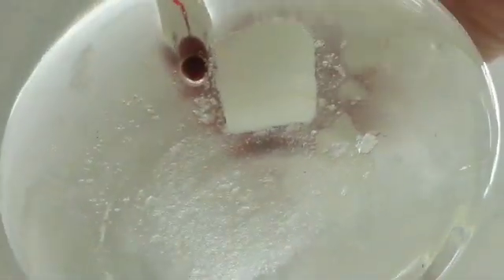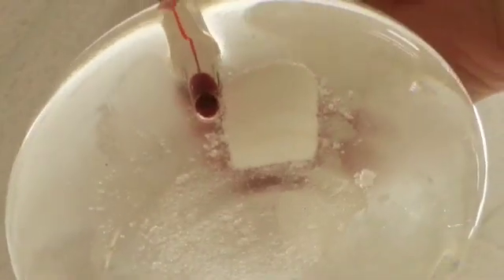So another thing to consider too is, as we're dissolving our sugar cubes in our Erlenmeyer flask, when we increase the temperature above room temperature, even at room temperature, we're still going to have to deal with some evaporative loss. That means some of the water molecules are going to escape through the top. Now when that happens, it changes the volume slightly. So for our intents and purposes right now, we're just going to assume or pretend that the volume isn't changing significantly and that our volume is still going to be around 75 milliliters of water that we started with. Okay? Just to make it a little bit easier for our calculations later.